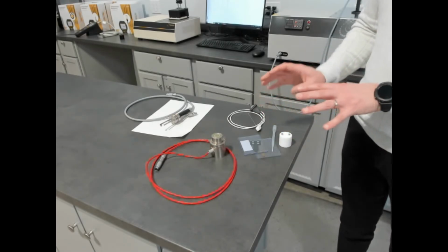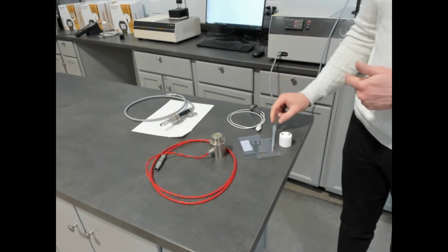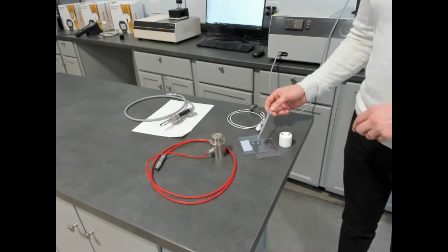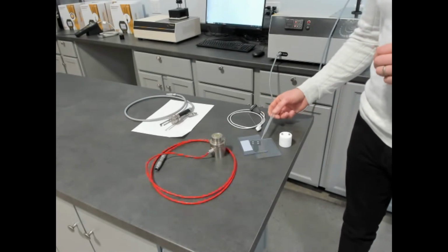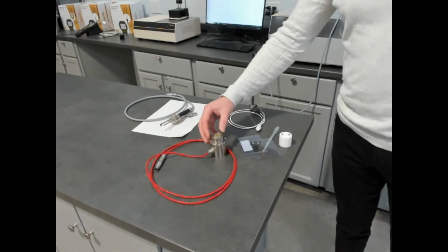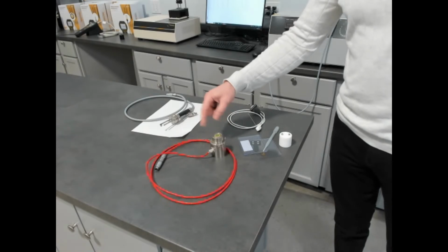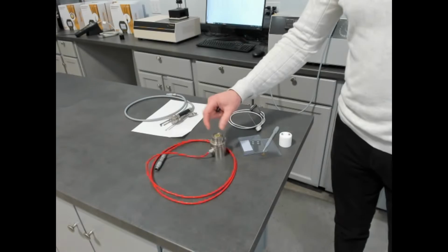But even then, as you get lower in viscosity or even higher in temperature, closer to the boiling points, often you have to input the volumetric specific heat of the fluid to correct for the complexity of the sample. So although you could optimize this primary method for solids to test fluids, you really have to be careful, and it's a complex measurement. The other method is the calibrated modified transient plane source. This does use liquids to offset the heat sinks that are within its design. This is around a 13 millimeter diameter.